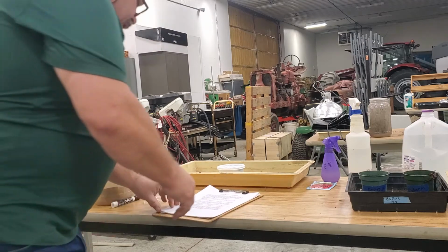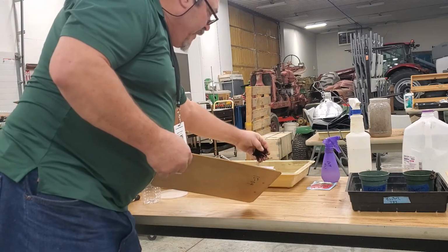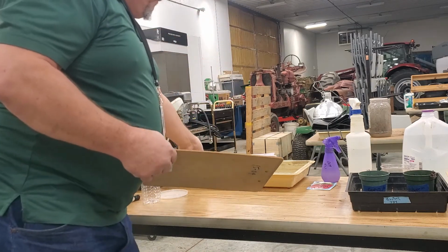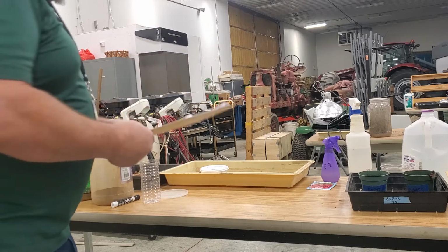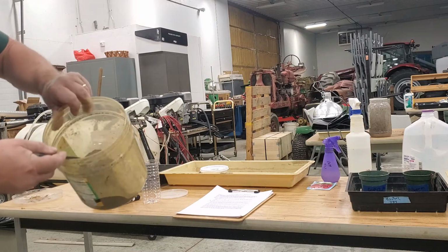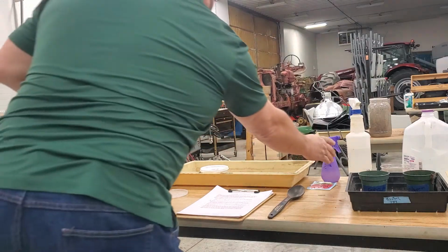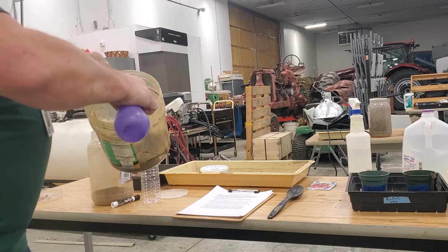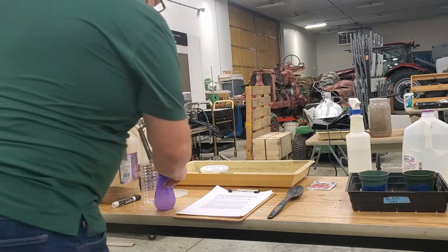So what we're going to do here is it says find healthy worms. So I got some healthy worms here. Actually, hopefully they're healthy. I got them at Walt's Crawlers at my local grocery store. It says pour them onto a dark colored, high organic topsoil, which I've done here. That's a dark colored organic soil. Doesn't look real dark there, but remember when you get something wet, to find out the true color, we get a nice dark soil. This is actually some topsoil out of my old yard, okay?